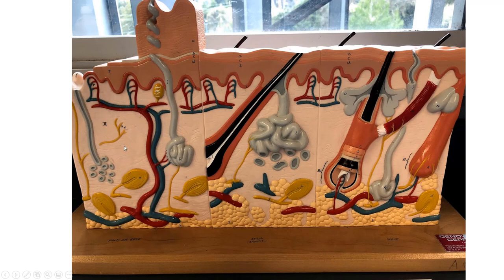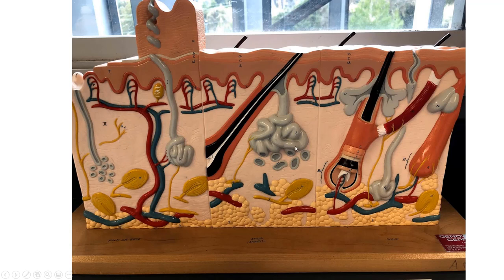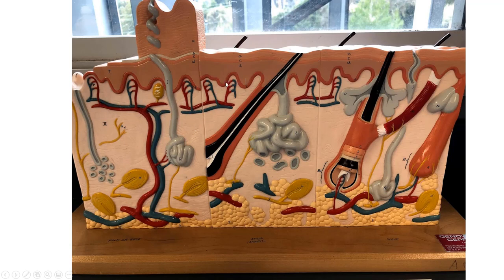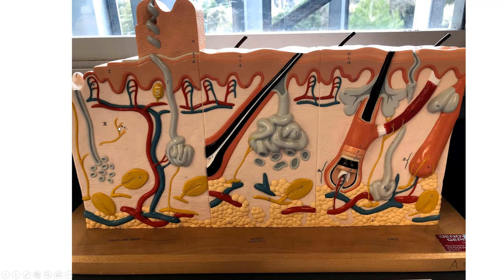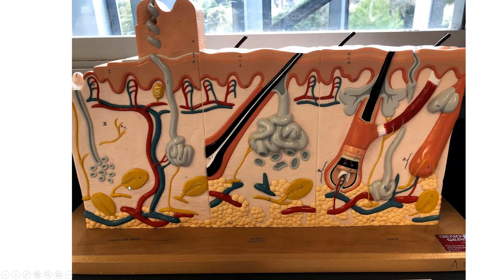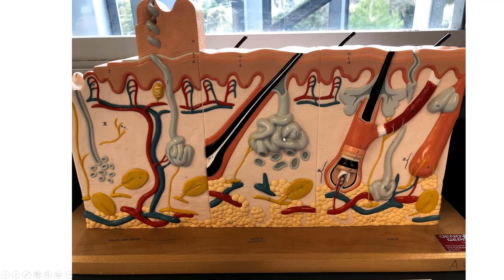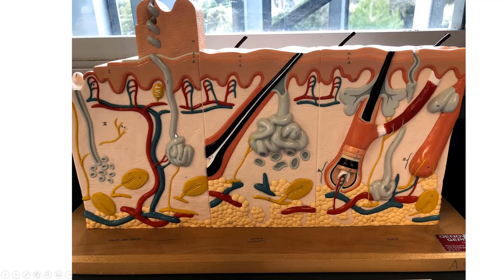The reticular region has dense irregular connective tissue. Looking at structures found here, we can start by focusing on the dermal papillae — here's a Meissner corpuscle. Here's a free nerve ending, which just looks like dendrite endings. This is a Pacinian corpuscle, and these are sweat glands with coiled up structures.